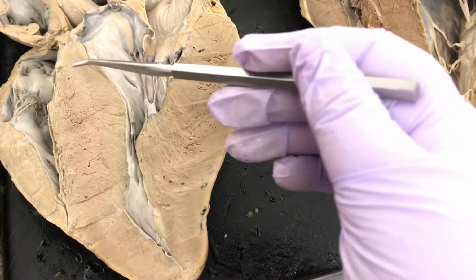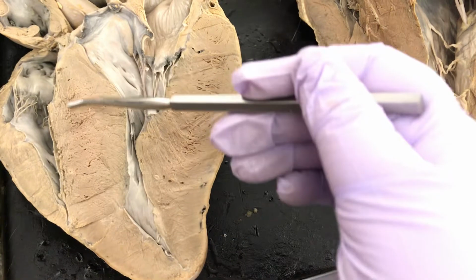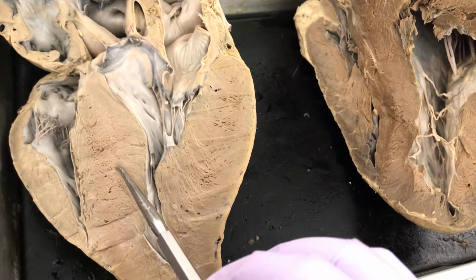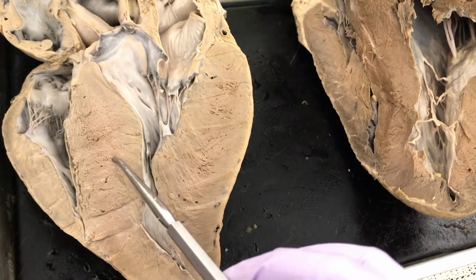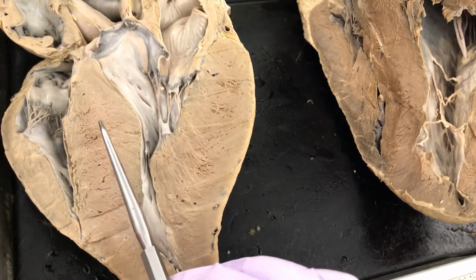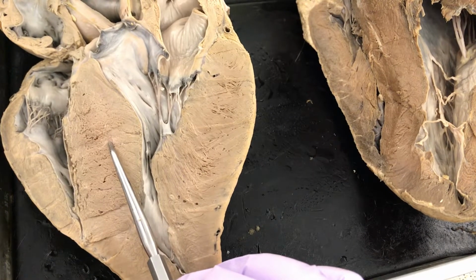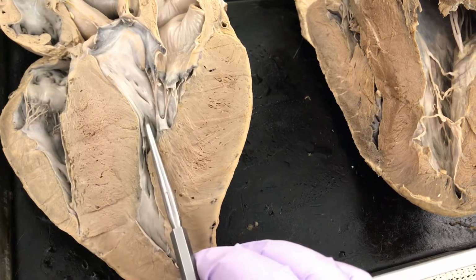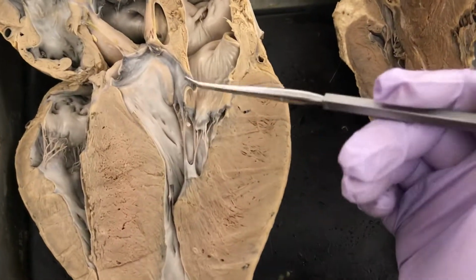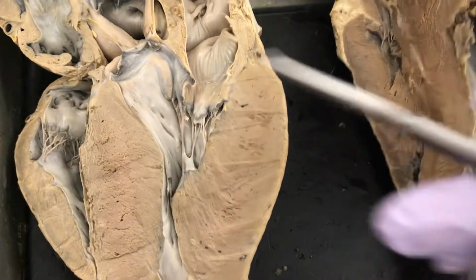Now, this part of the myocardium is actually between the ventricles. So if I pin here and I ask you what structure is this, then clearly I'm not asking for the muscle. I'm asking for interventricular septum, the dividing line between the two ventricles. Interventricular. All right, now those are those two valves and some structures.